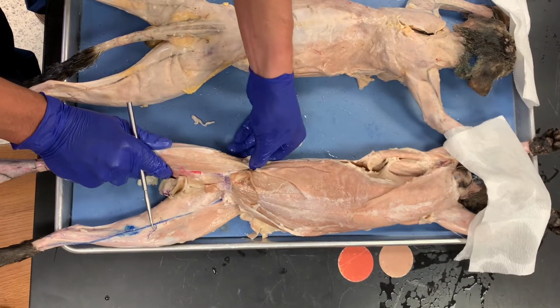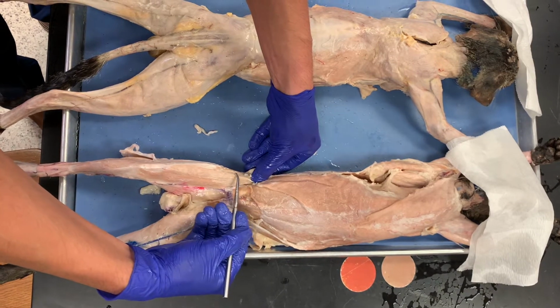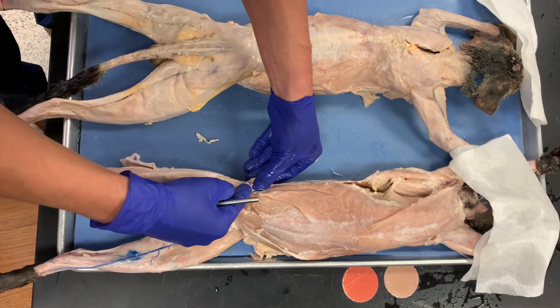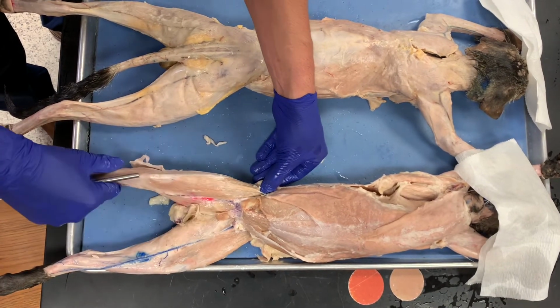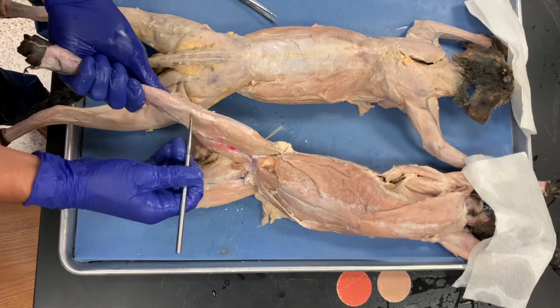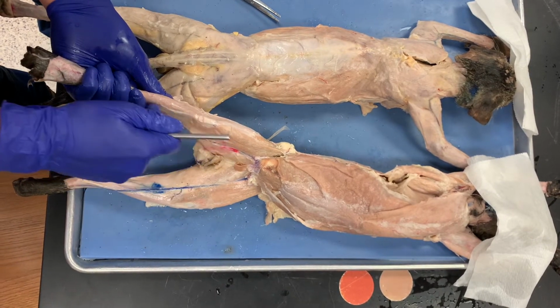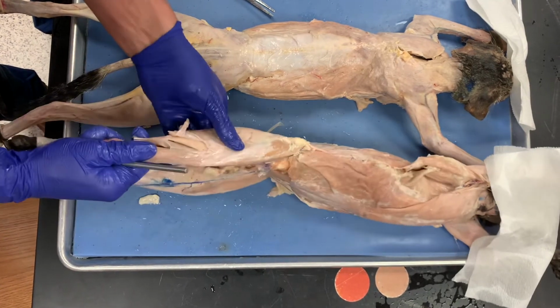So the AIIS would be up here, and the rectus femoris is like this one that's right in the middle, straight. So rectus femoris would be here, vastus medialis would be here, and then vastus lateralis is here on this side. And then if you work your way downwards, this is where the tibialis anterior would be, because it's right next to the tibia, so you can see the bones coming this way. So tibialis anterior is there.